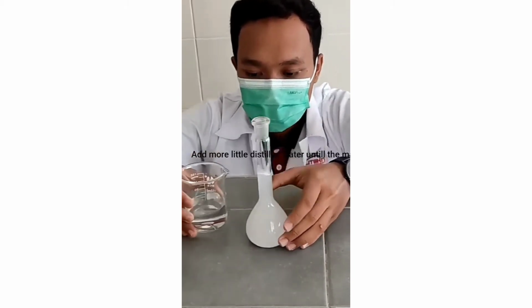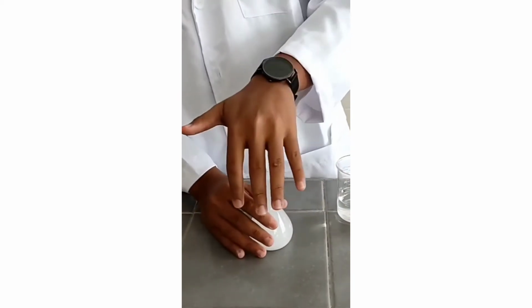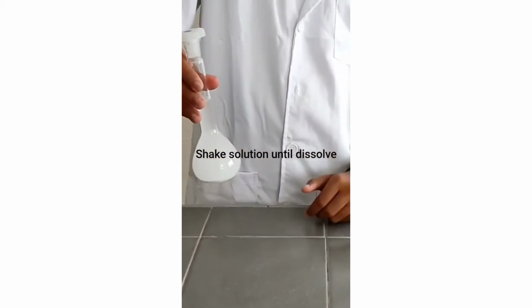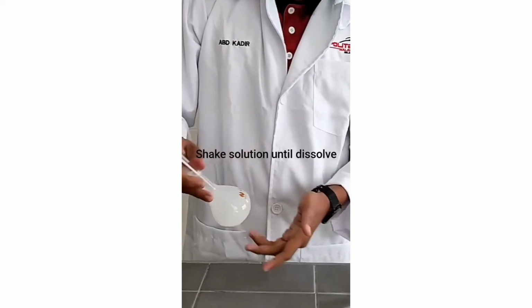Okay, nice. Then close the volumetric flask and shake the solution in the volumetric flask.